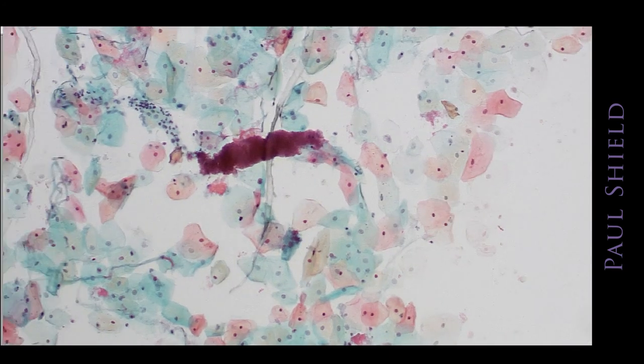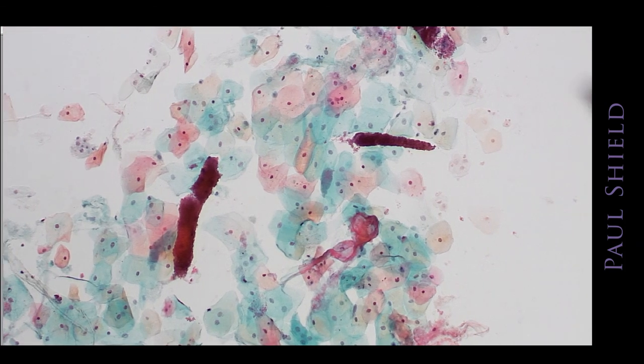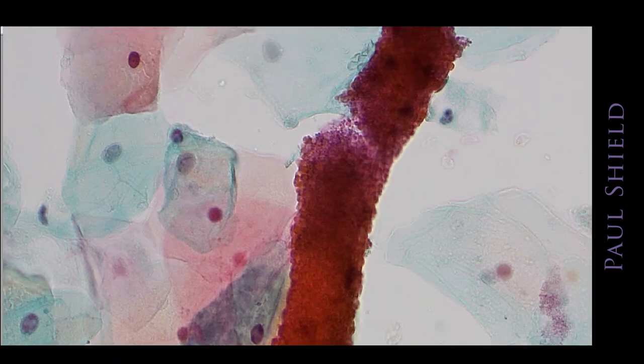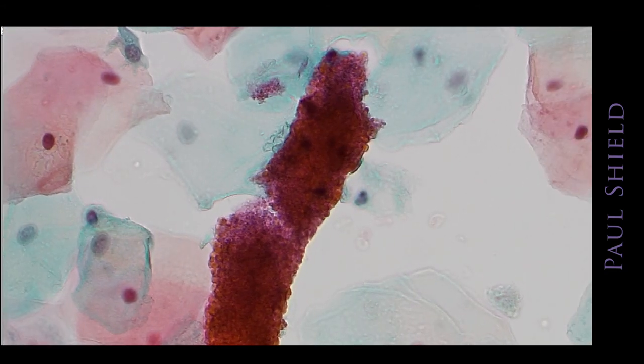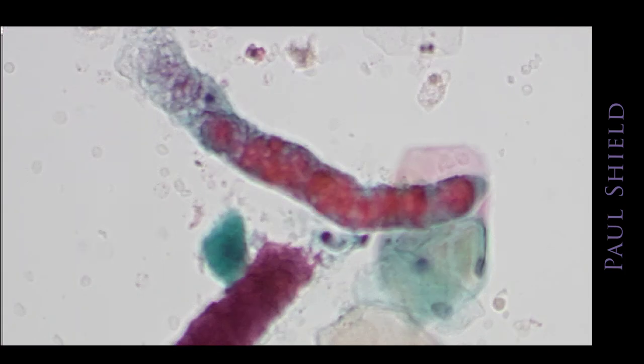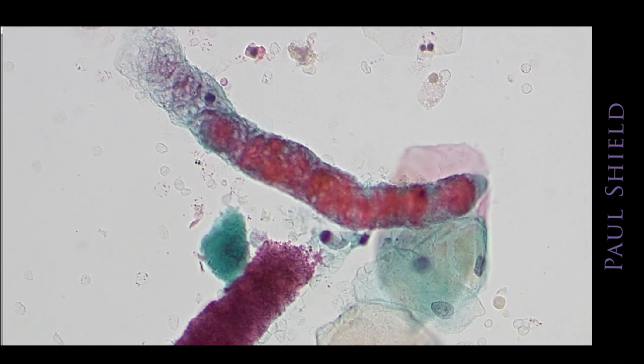Casts are something that we do report, and these are a sign of renal damage. Here's a sample that's mainly squamous cells, but it has these worm-like casts in it. You can see they have tubular shape to them with parallel sides and blunt ends, and these can be cellular or just granular. This one probably is red cells, I think, and sometimes they'll have a kind of waxy appearance and be acellular. Here's just another group. These are definitely red cell casts. You can see the outline, the ghost of the red cells in them.